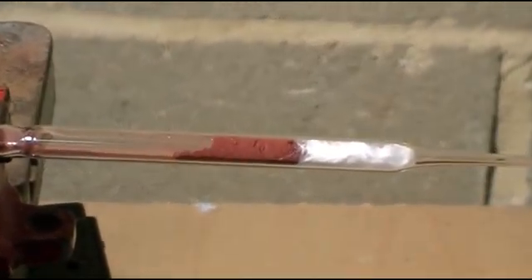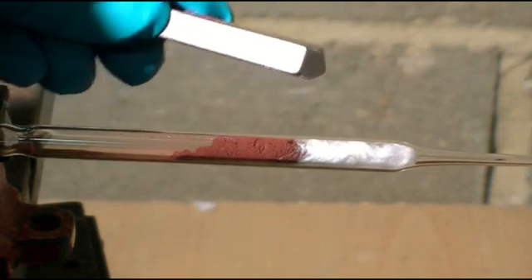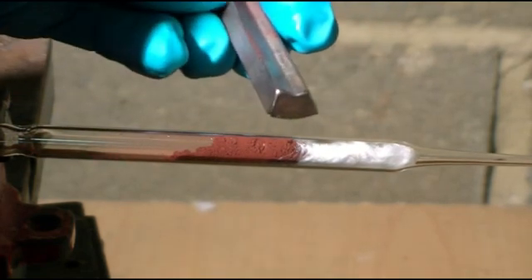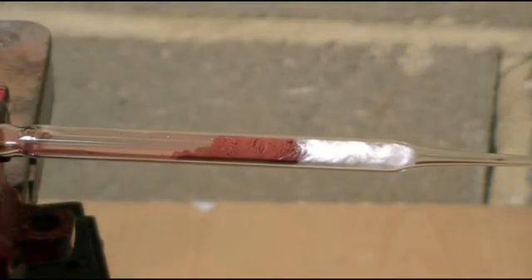Now if we hold a permanent magnet next to our hematite one more time, we can see there isn't really any interaction between the hematite and the permanent magnet. The hydrogen, by the way, was generated from our electrolyzer.